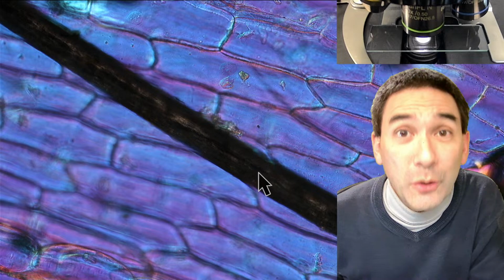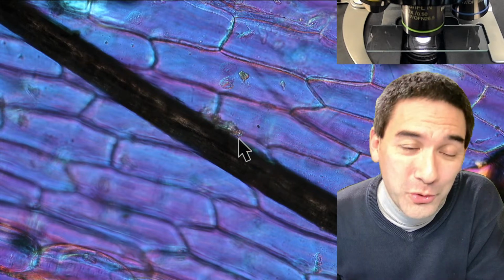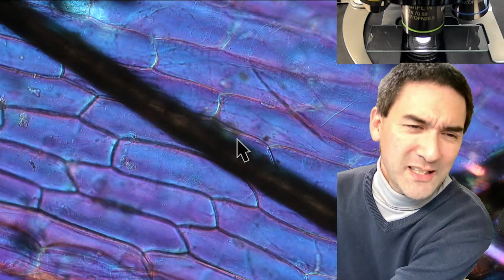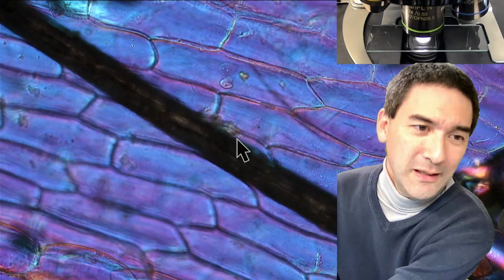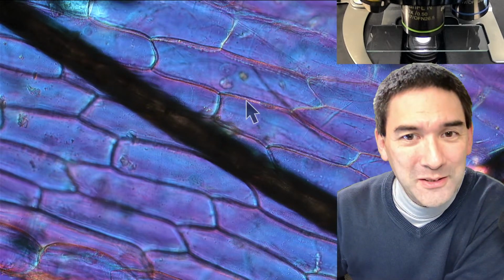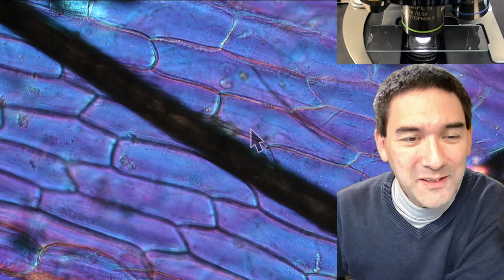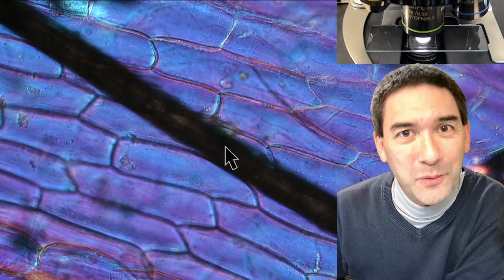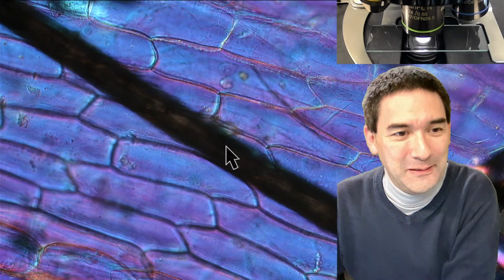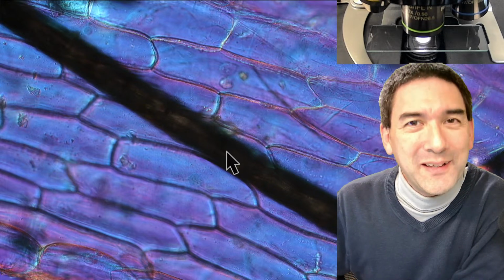Those onion cells are pretty large. Obviously, that's why they're such a popular specimen. But I just wanted to show you that if you want to know how big a cell is, they're kind of small, they're tiny. And in many cases they indeed are. But some cells like those onion cells over here, look, they have the same diameter as one of my hairs. I just wanted to show you that sometimes some cells are not as small as we might think.